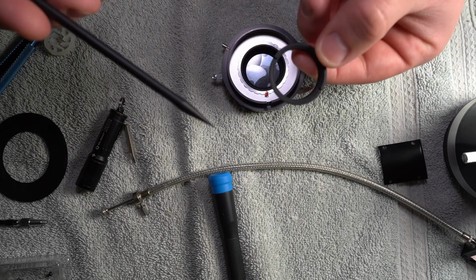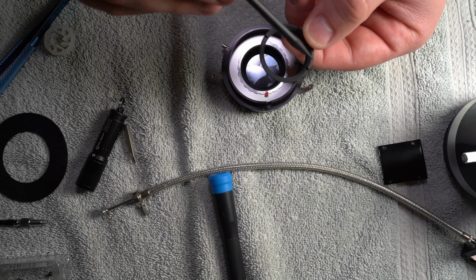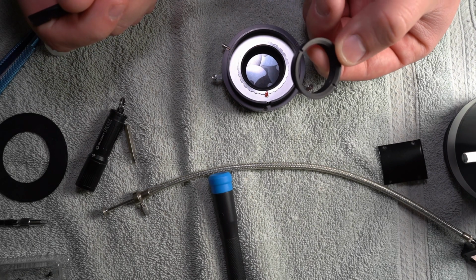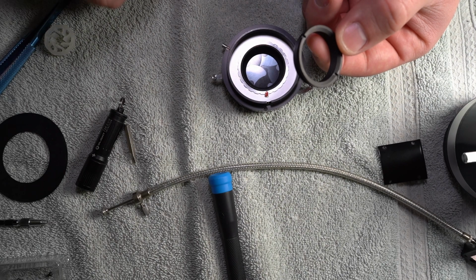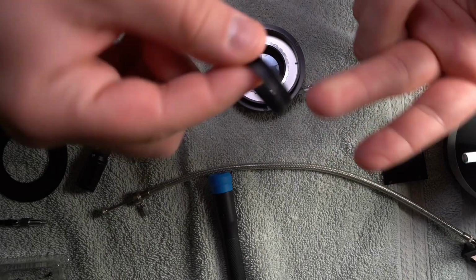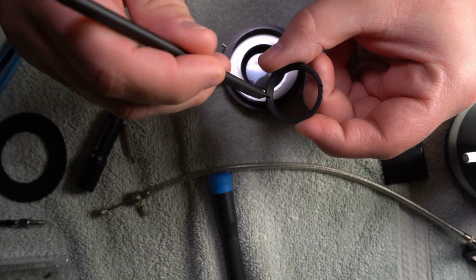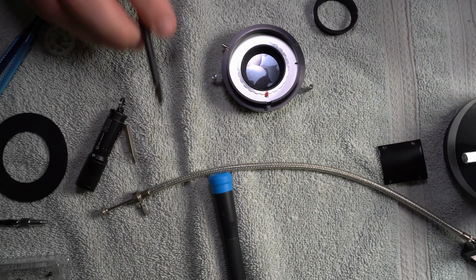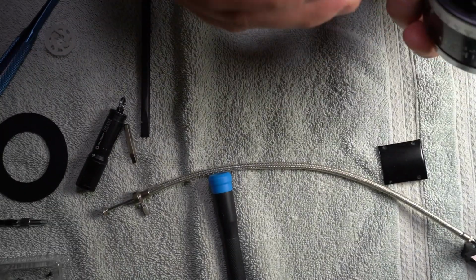That big top hat looking thing was a spanner nut. This is a spanner nut. It's just the other design. It's got slots in here instead of pins. And you can kind of see the slots right here. And I don't have the specific tool for that, but again, basically finger pressure. With this one, I actually had to use the spudger thing here and loosen it, but it was already loose, so it worked perfectly.